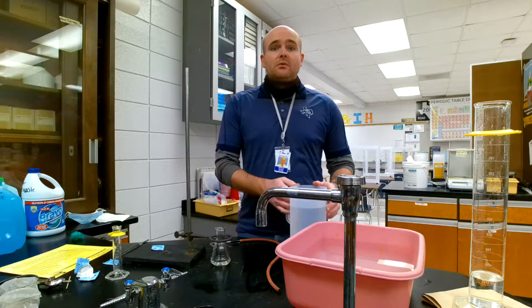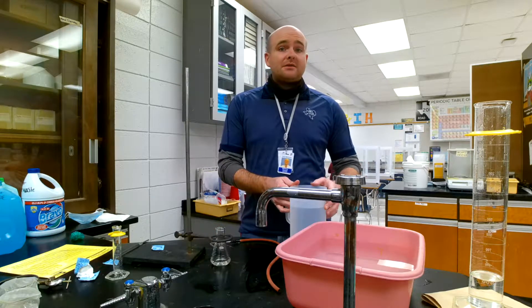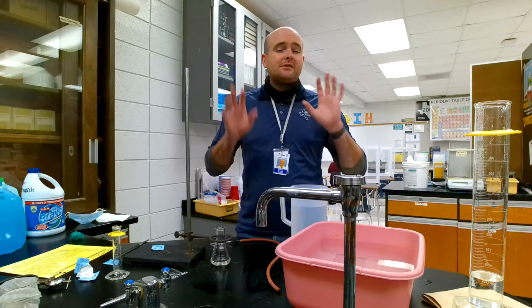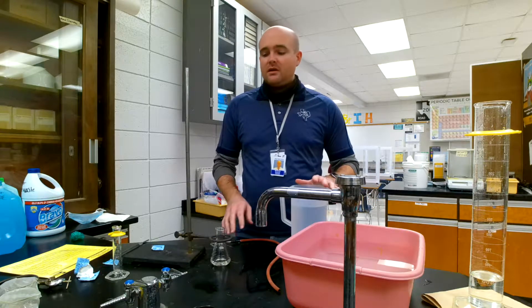All right, howdy guys. We're ready to start our Alka-Seltzer lab, which is about kinetics. We're just going to look at the rate of the reaction. Remember, that's all we're really focused on.